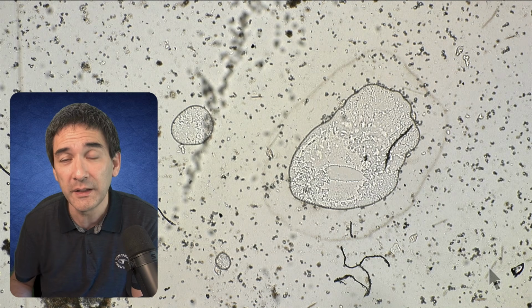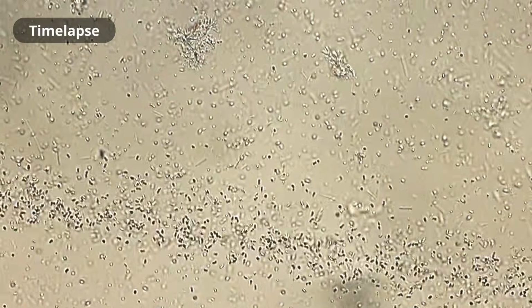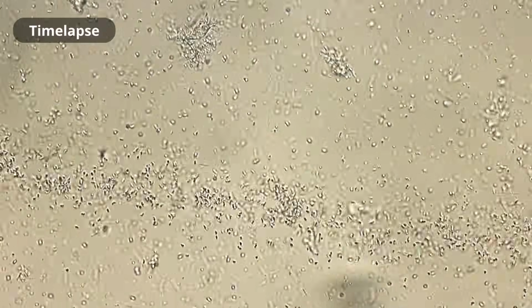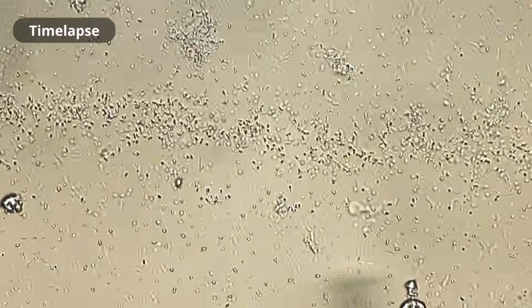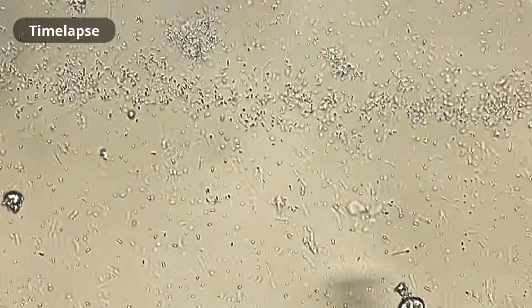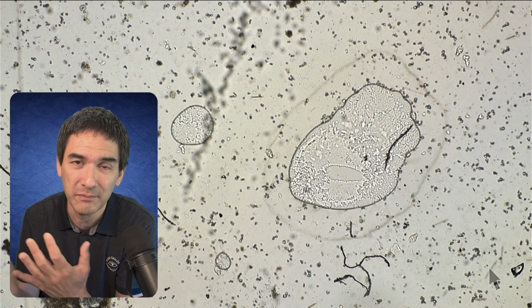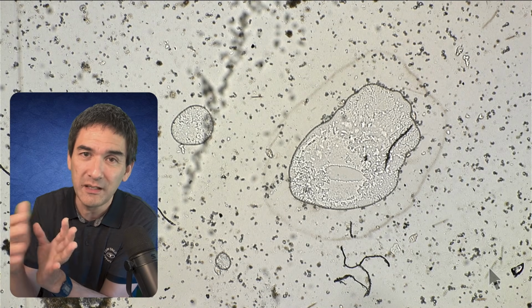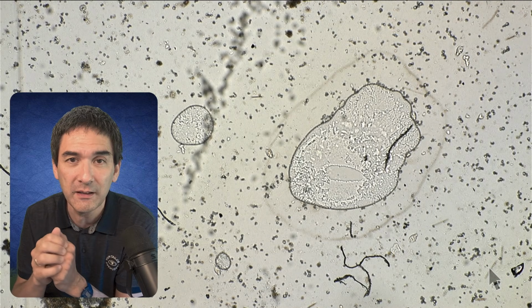There are also different regions of oxygen concentration under the microscope slide. So sometimes those aerotactic bands are not completely straight, but will go around a corner, for example, or if there's some debris in there, then this can distort it a little bit. Basically, dirt and debris interfering with the diffusion of the oxygen. Very fascinating in my view.